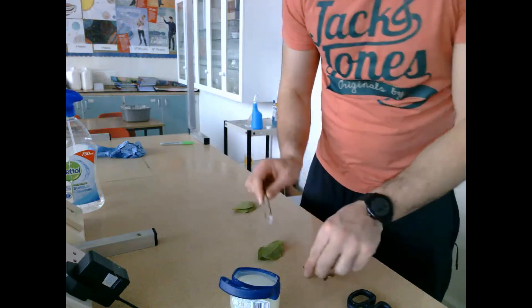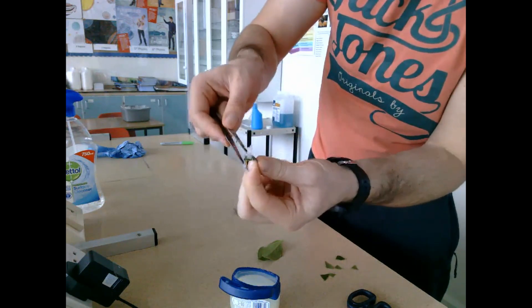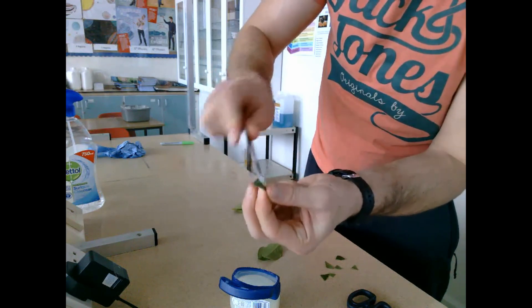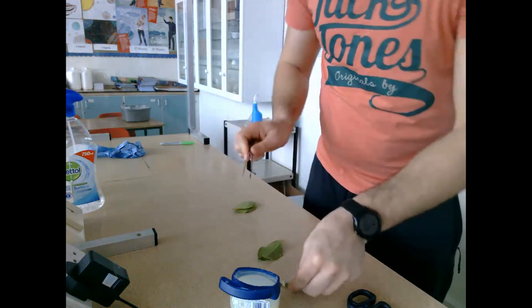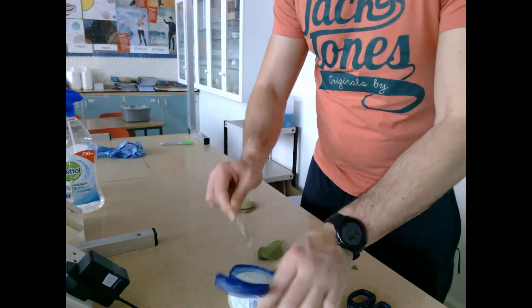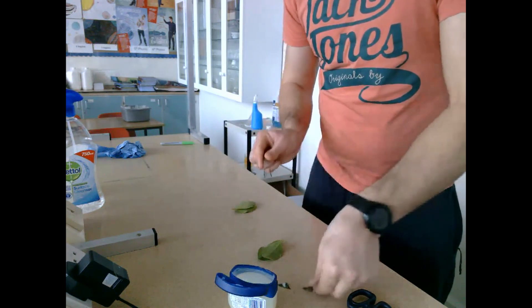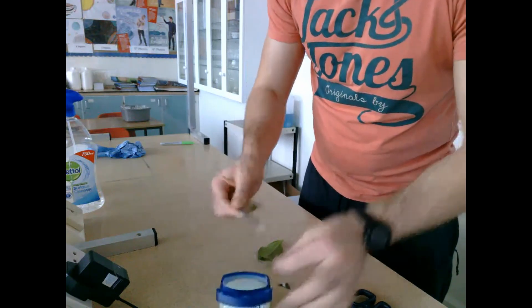The vaseline goes on the shiny upper surface of the leaf, because that's the part that will be attached to the lid of the malt agar plate. This is because leaf yeast is found on the underside of the plant. Once the leaf pieces have been attached to the agar, we leave them standing for 24 hours to allow the leaf yeast to fall onto the malt agar, which is its nutrient and will allow it to grow.